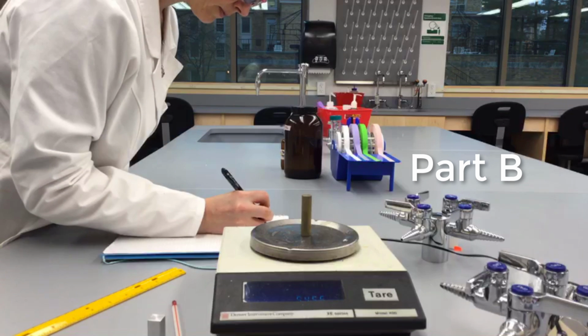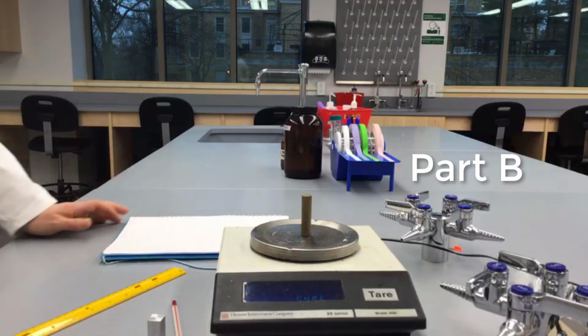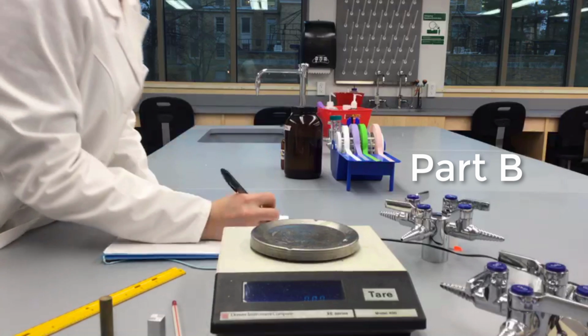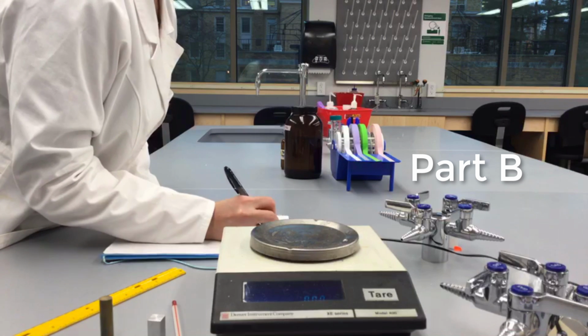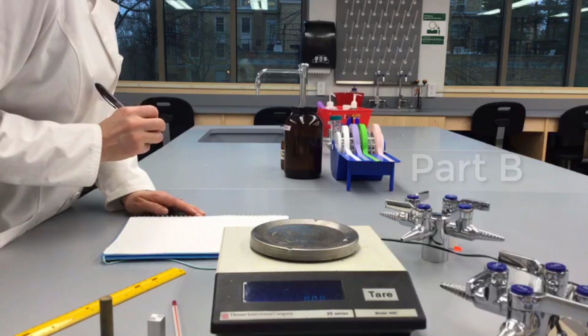Make sure you show all of your calculations and that you use the rules for significant figures correctly when recording your data and when doing your calculations. You will be able to use the density of each bar and its color as clues for identifying the metal composition of each bar.